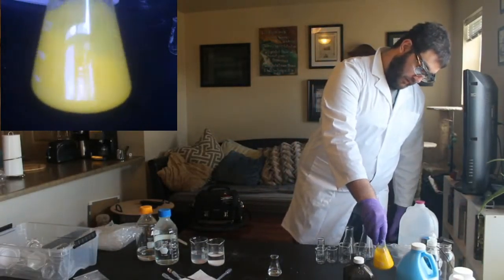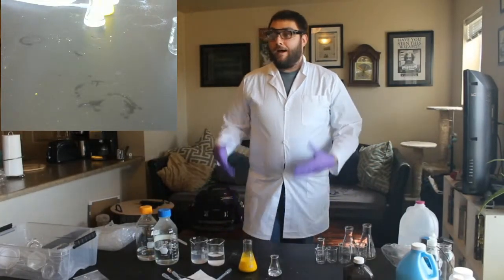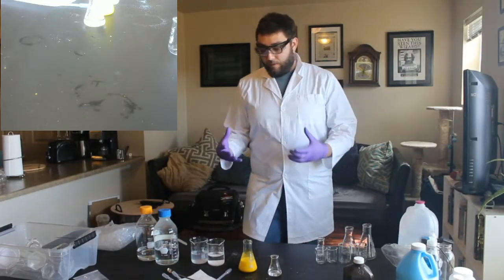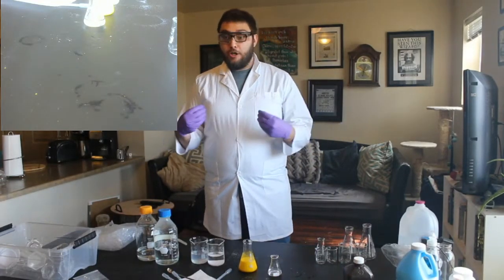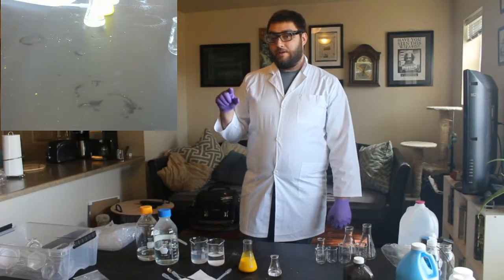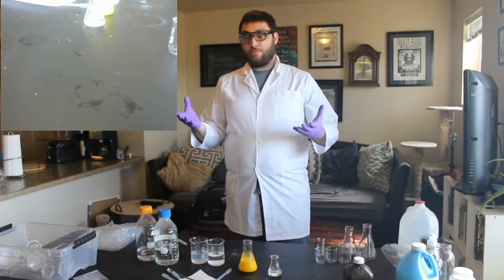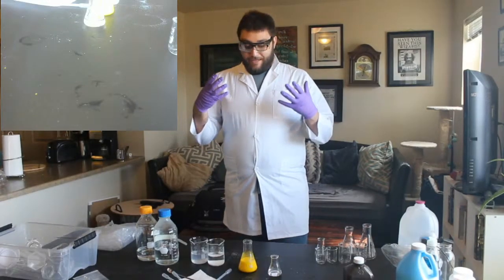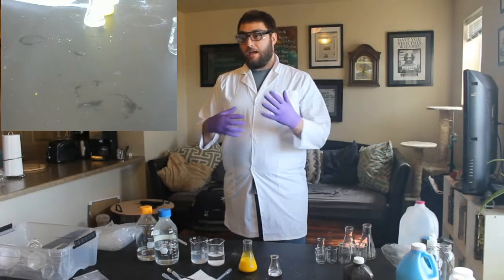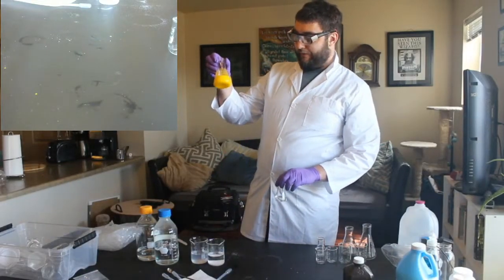And this one, it's the same thing. We created something brand new from those chemicals. We combined those chemicals and we made something new that didn't exist before we combined them. And now that new thing also doesn't dissolve in water, but it also is bright yellow. So since it's not dissolving in water, it falls out and it's really colorful. So we make this really bright yellow gold precipitate to make our new compound. And that, again, that's from lead.